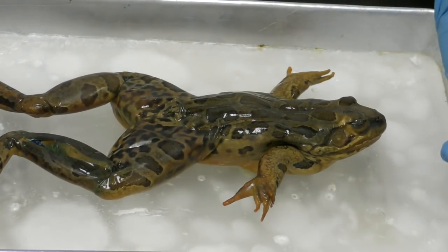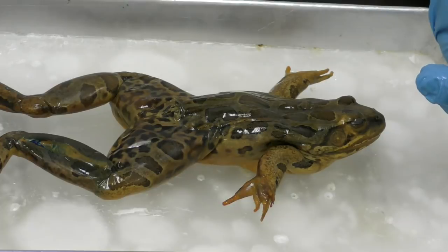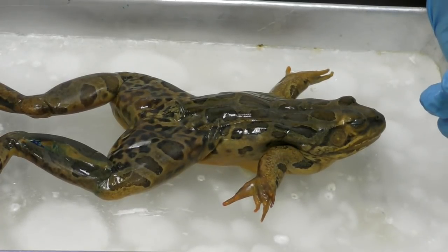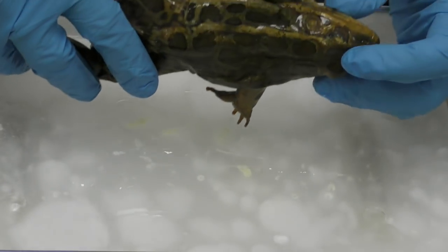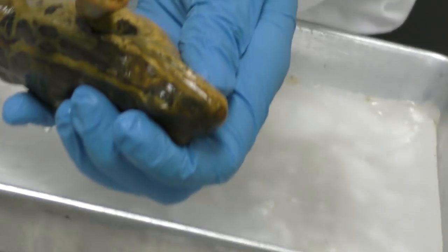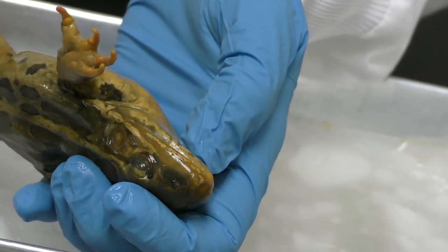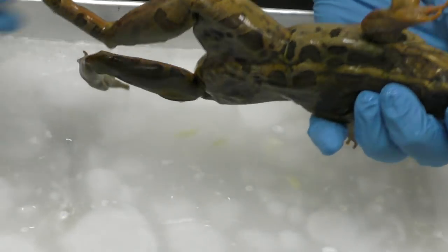The first system that we get to is on the outside of this frog, and in the human body it encompasses the skin and the pores and the nails and the hair. No hair on our frog, but our frog does have pores. Their pores are a lot smaller than ours. Any of their membranes, I don't know if you can see this, I'm going to try to get it up. So we've got an eyelid, and then we have a nictitating membrane, because frogs have 2 layers over their eyes. And that is also included in this system.